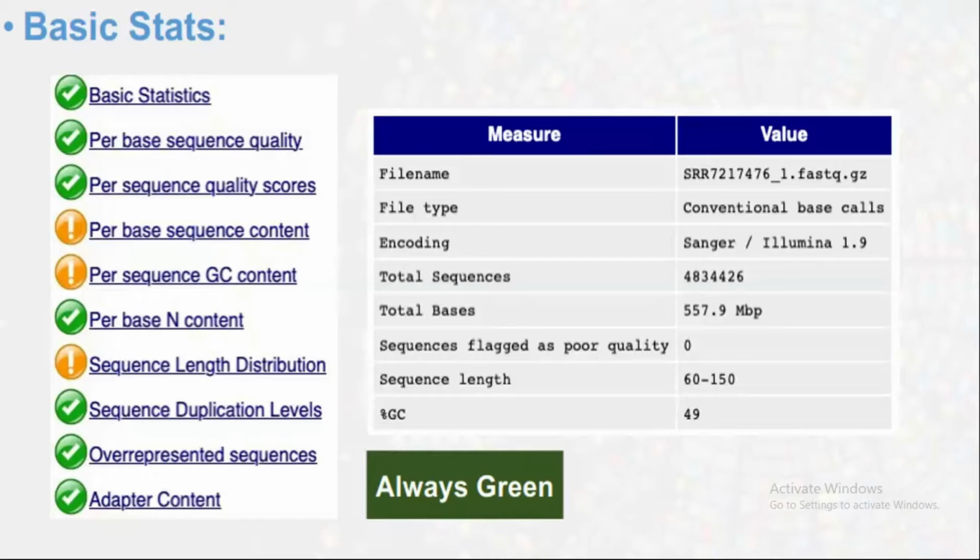Now the most important thing is the sequence length. My sequence length here starts from 60. The lowest sequence read is 60 and the largest is 150. Basically, I pre-processed this data, and this is the FASTQC report of that pre-processed data.